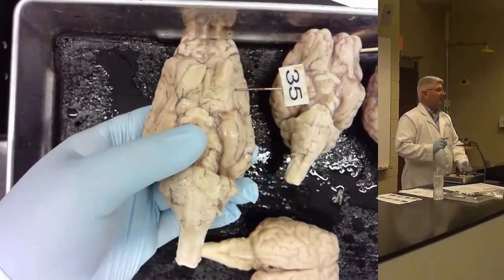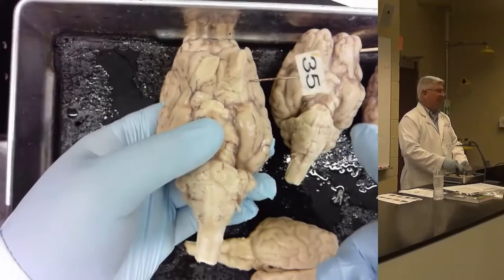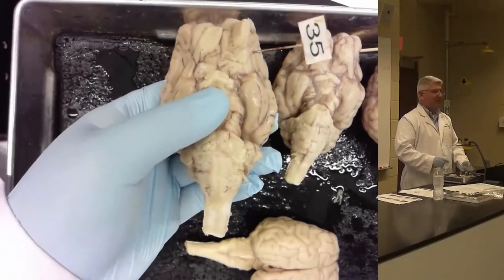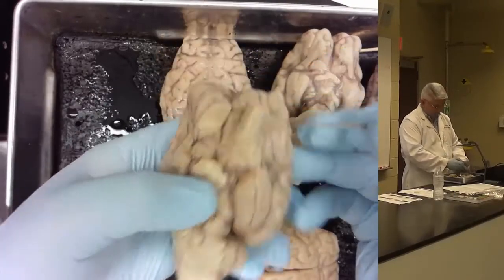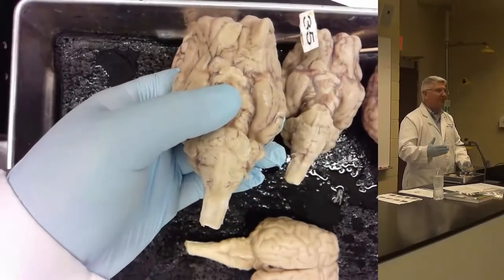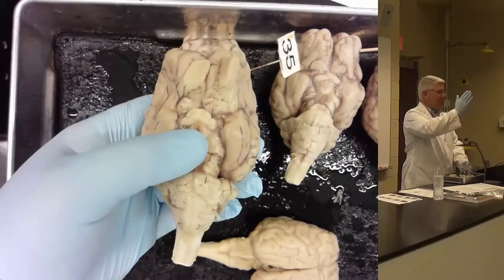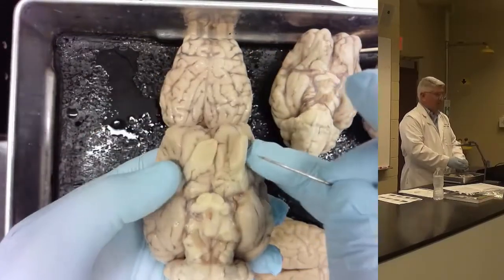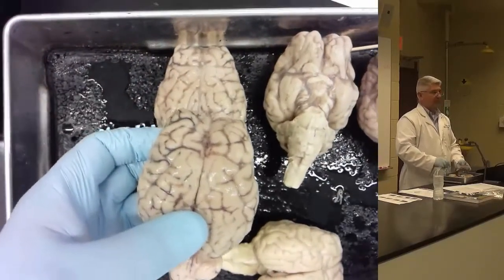And when I mark it, it's going to be marked like this. Okay? Sometimes people forget if they're looking at the top or the bottom of the brain, and they just see a pin stuck out to the side and they go, inferior frontal gyrus. No, you cannot see the inferior frontal gyrus from the bottom of the brain, from the ventral part of the brain. Okay? I will never mark the inferior frontal gyrus like that. I won't do it because you don't have any landmarks. You can't tell what it is. You have to be able to see the cruciate fissure, the longitudinal fissure, superior, middle, and inferior in order to make that distinction. Same thing with the orbital gyri. I'll never mark the orbital gyri from the top. It's not a top view structure. Okay?